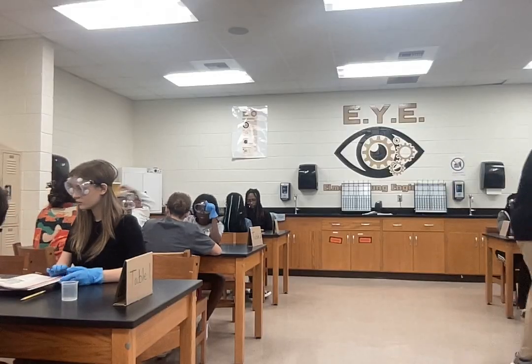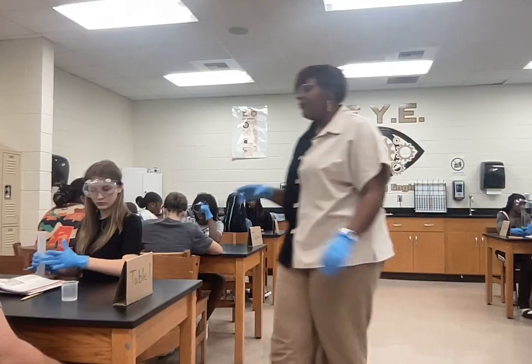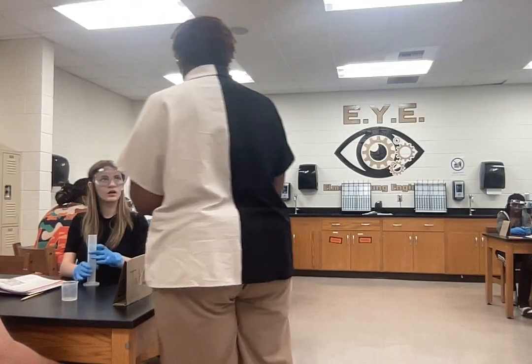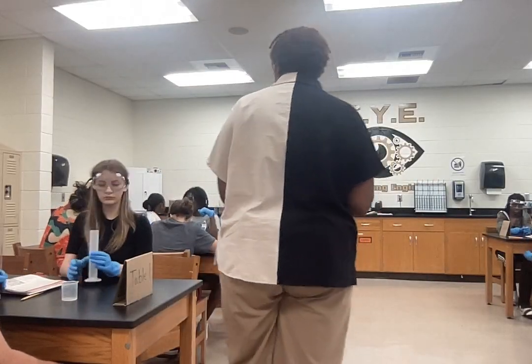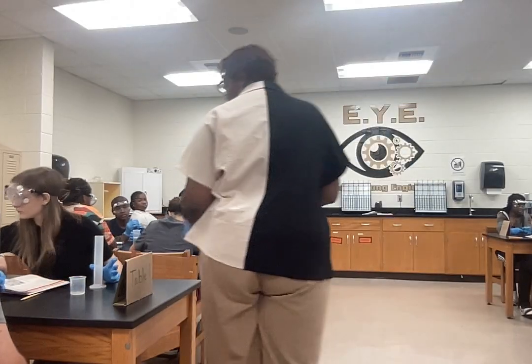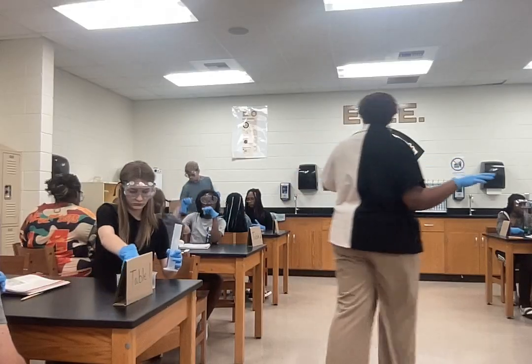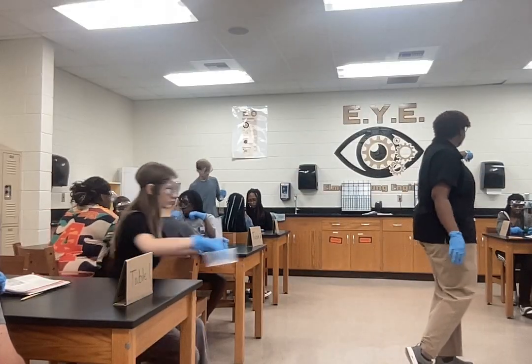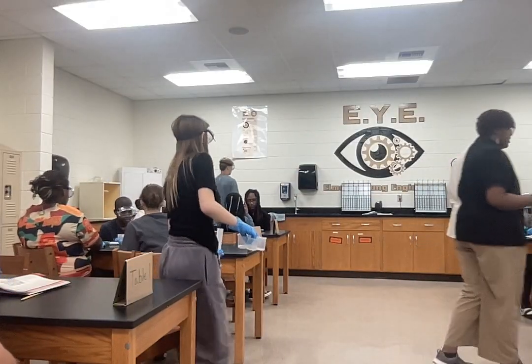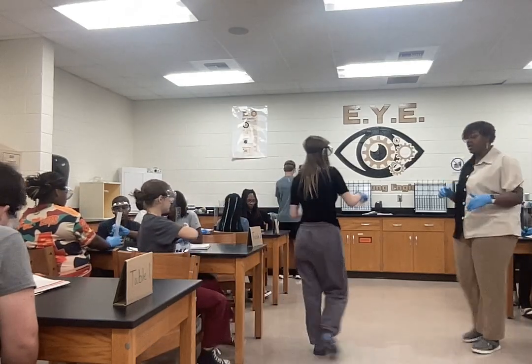Take the graduated cylinder and the things that you measured with, right? Everything except for your density column and any other things we used to measure. So basically the cups right here, go to the sink and I want you to rinse them out. There are paper towels, listen carefully before you get up. Paper towels at this sink only, so please don't make a mess. Remember the water has a lot of pressure behind it, so careful turning it on, okay?